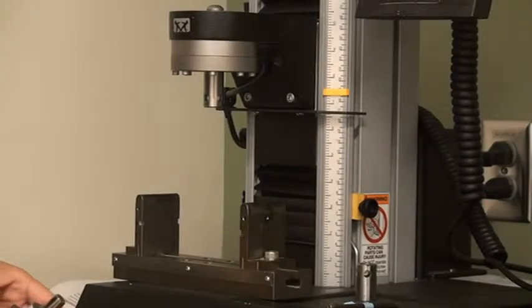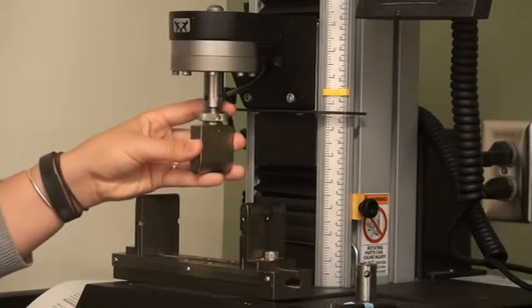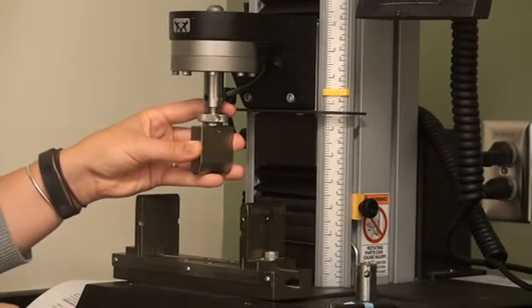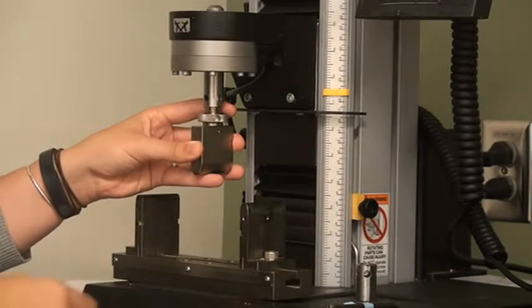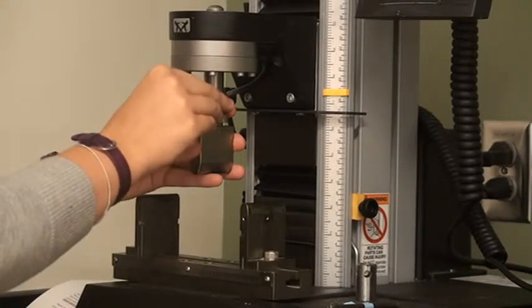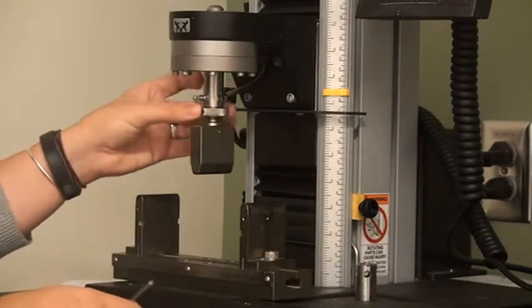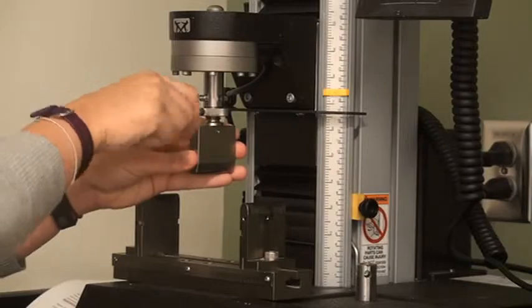Next, install the upper assembly of the flexure fixture by inserting the pin connector into the upper collet. Make sure you have a firm grip on the assembly with one hand and use the other hand to insert the pin, making adjustments as needed to line up the holes. Finally, tighten the lock nut by turning it counterclockwise until it is tight against the upper collet.